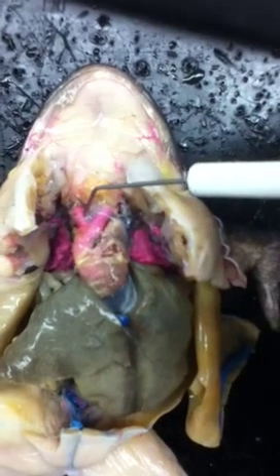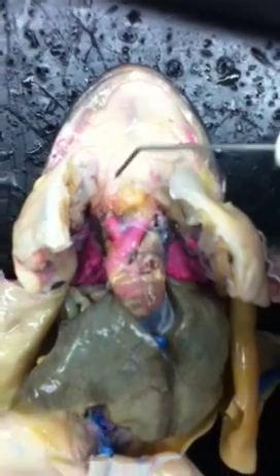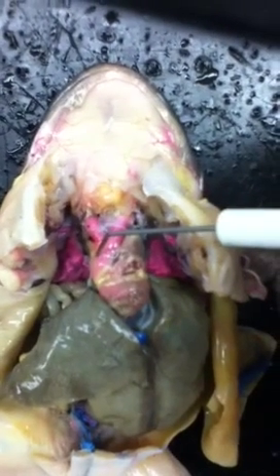These two vessels coming out of the heart will be the truncus arteriosus, and this one right here will be the conus arteriosus. We'll start with the arteries first.